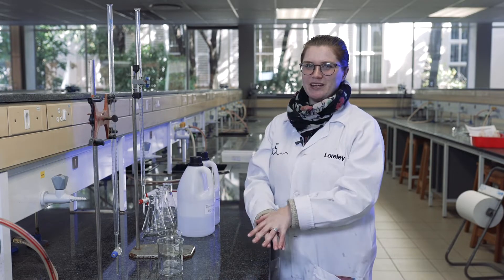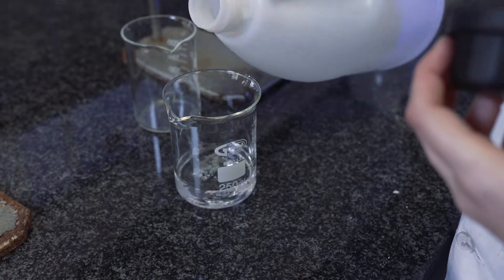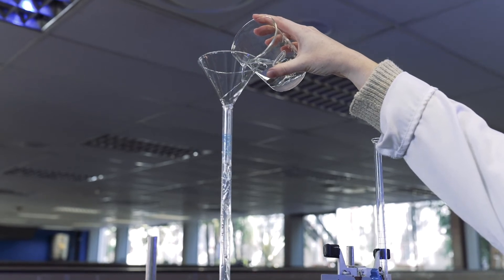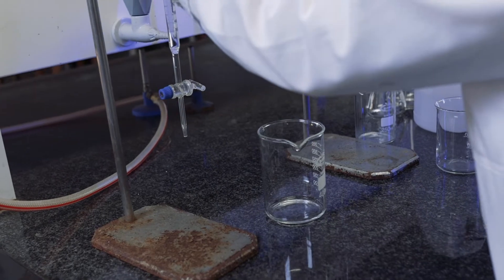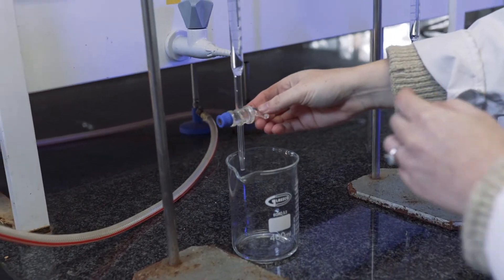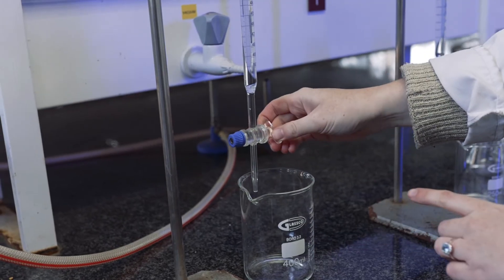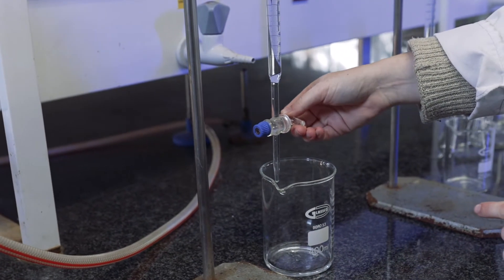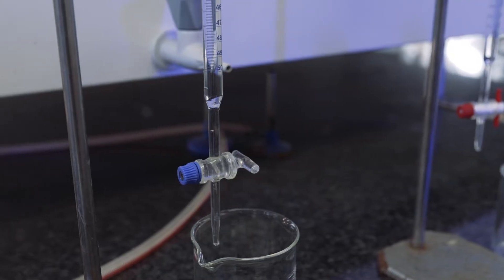We're going to start this experiment by preparing two burettes. Our first one is going to be our hydrochloric acid and our second one is going to be our sodium hydroxide. We need to make sure that no bubble forms at the bottom, so we empty some of our liquid into a waste beaker and then we hope all the bubbles fall out so we can continue.